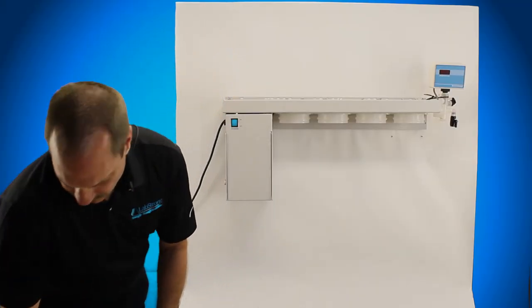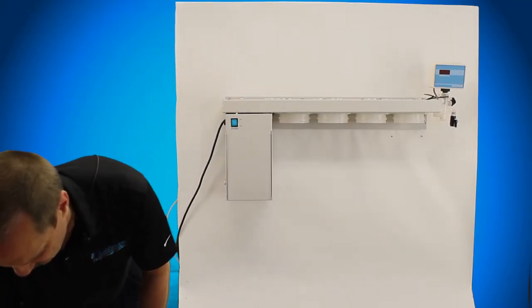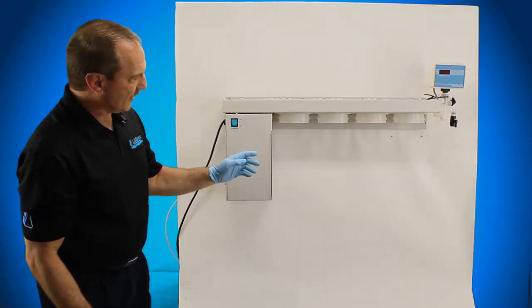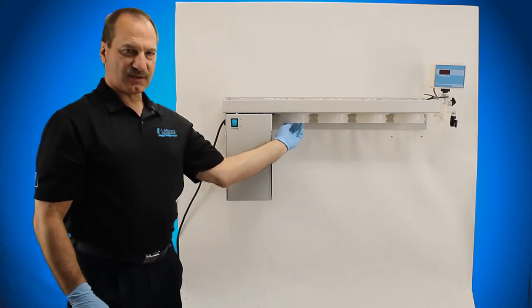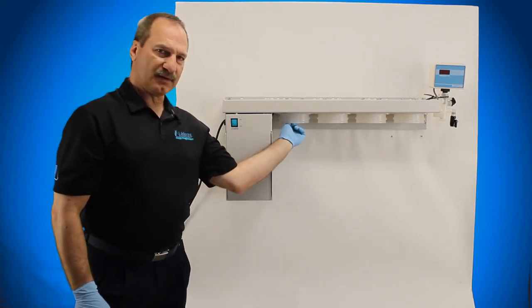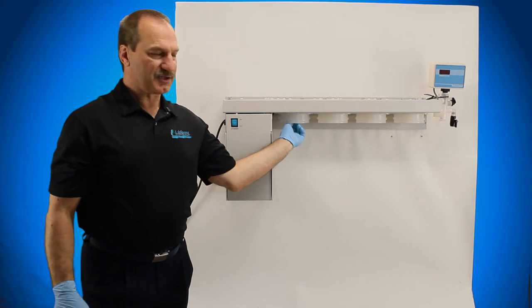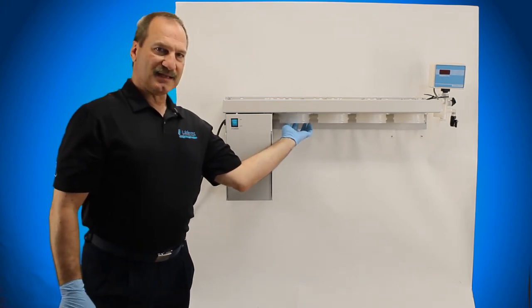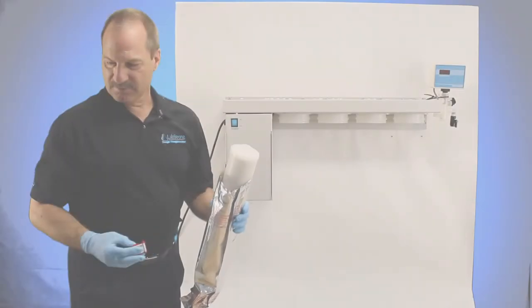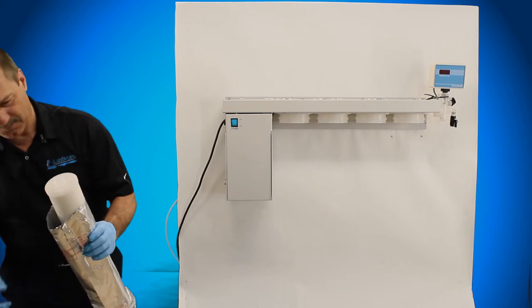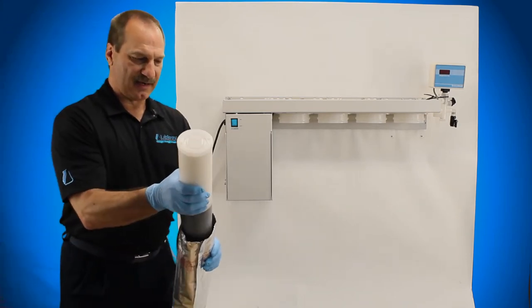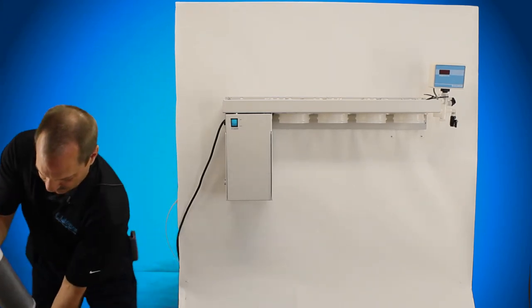Now when you have all your canisters out, you're going to want to go ahead and replace your GSX-27 small o-ring up here because that's where your cartridge is actually going to seal. This is where you need this to really seal very well. Once those are removed, you pull your cartridge out of the bag and set the bag aside.